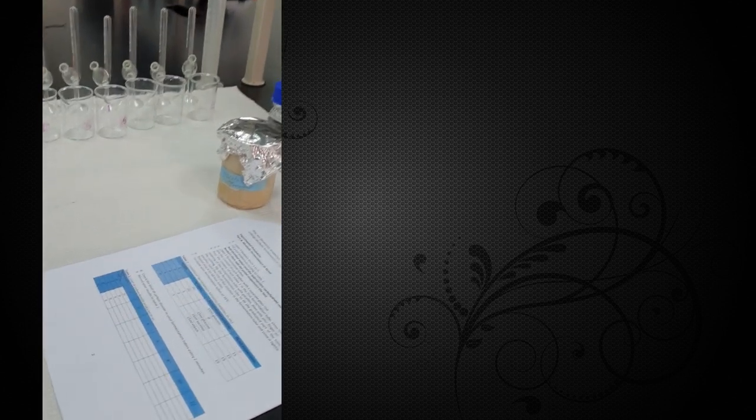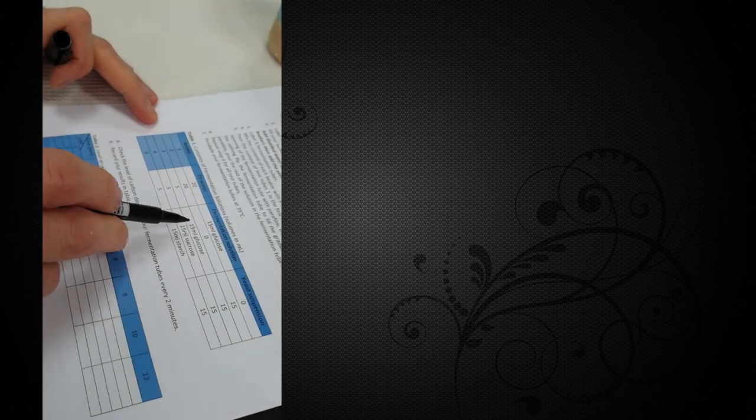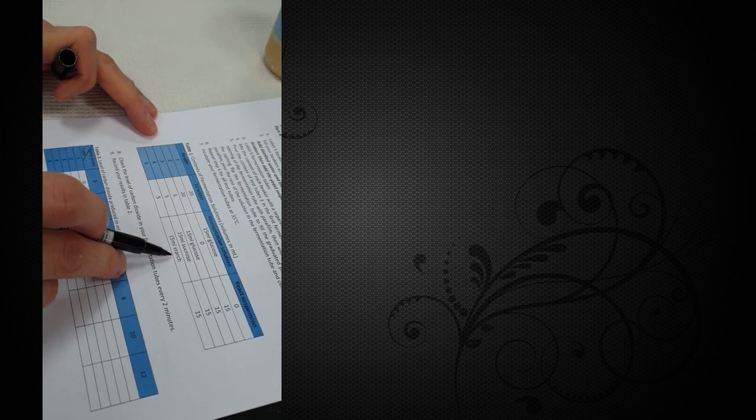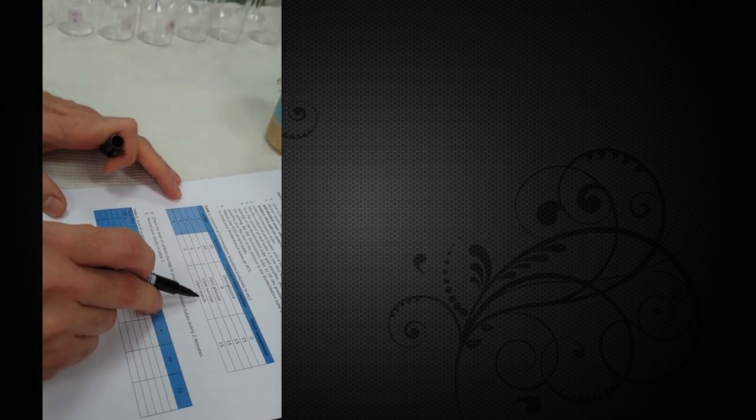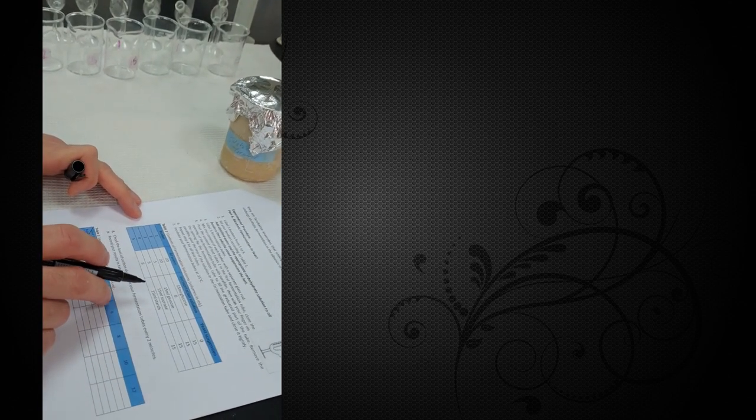Specifically, we will be looking at whether the type of carbon source makes a difference. You'll be looking at whether glucose, sucrose, or starch are the preferred carbon source for yeast fermentation. We're going to be looking at how fast each one of these actually works in terms of fermentation, which one's the best one for yeast.